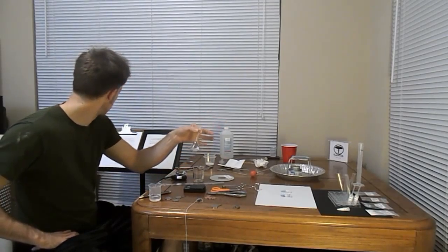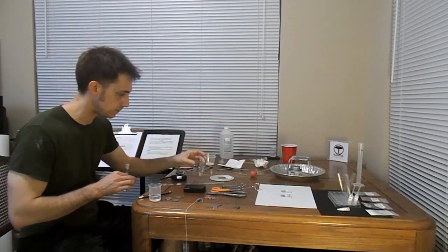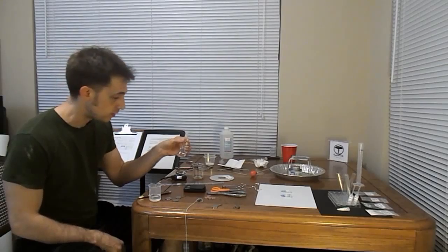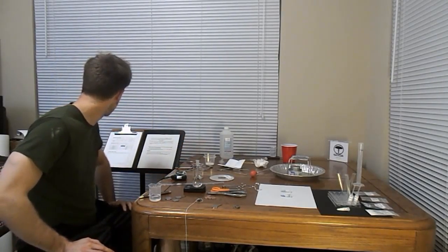Alright, so having prepared a solution that's 6 milliliters of my original solution combined with, presumably, 19 milliliters of distilled water, we're taking the mass, and we'll calculate density and molarity off camera, because gosh, who wants to watch that stuff? Lab 2 coming up next.